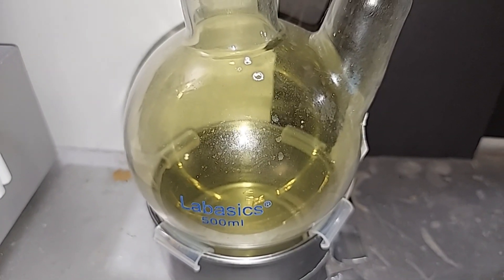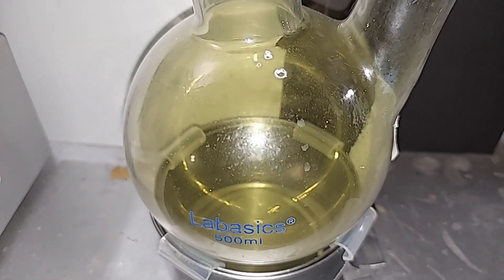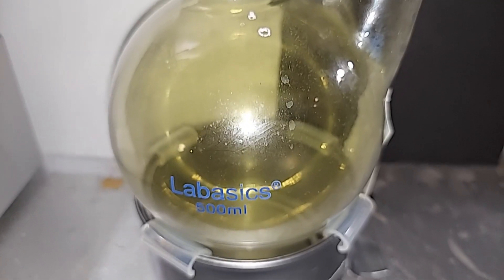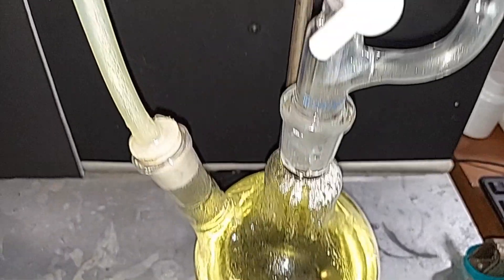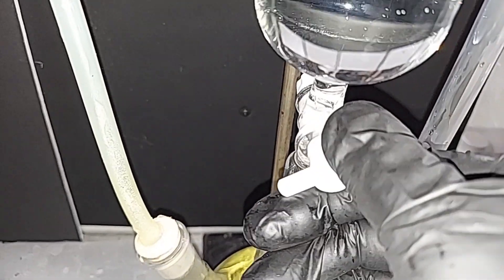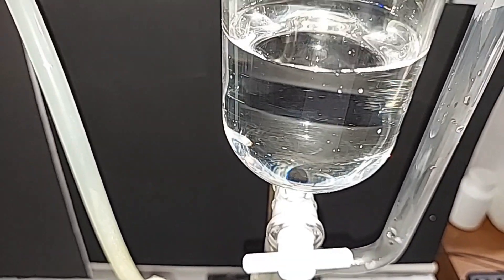I just had to show you this backflow catcher is full of chlorine gas, obviously. Look how green it is. One hour is up, so I'm going to discontinue the chlorine gas by turning this off. We used maybe two-thirds of the hydrochloric acid that was in there.